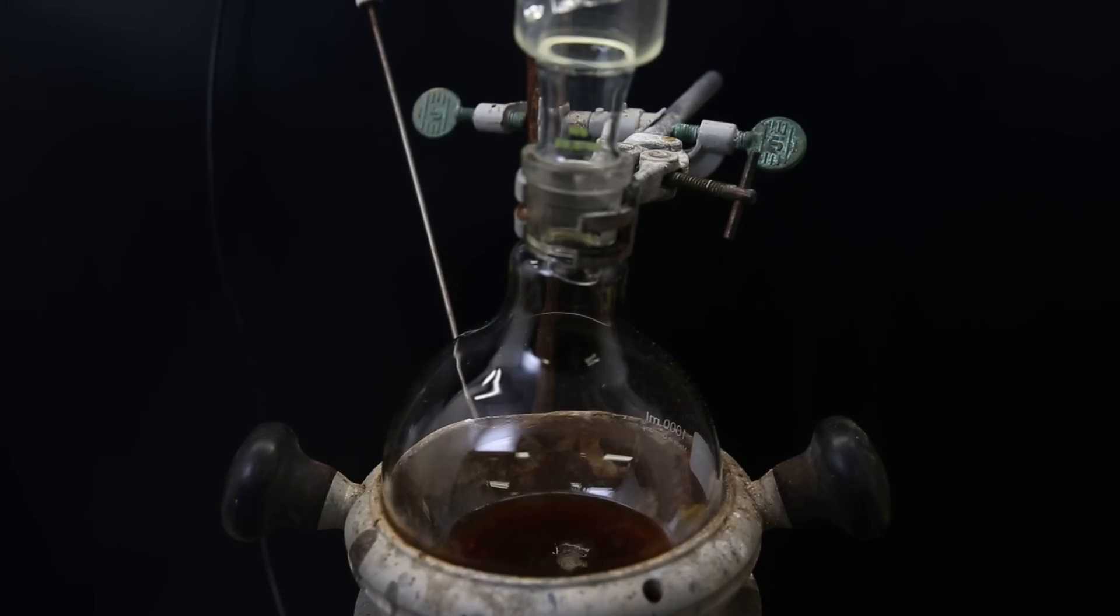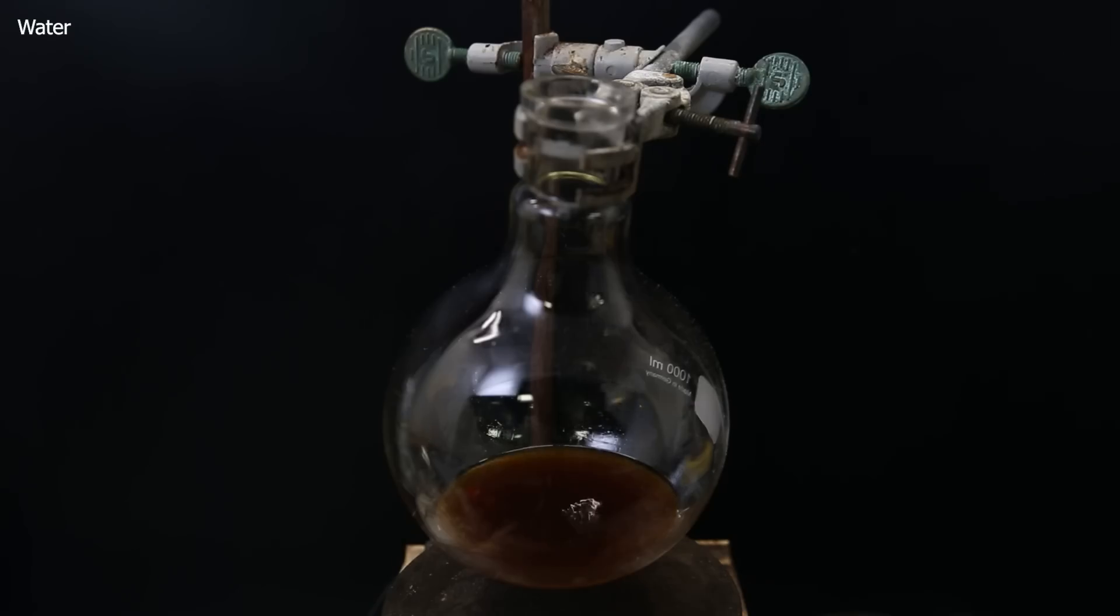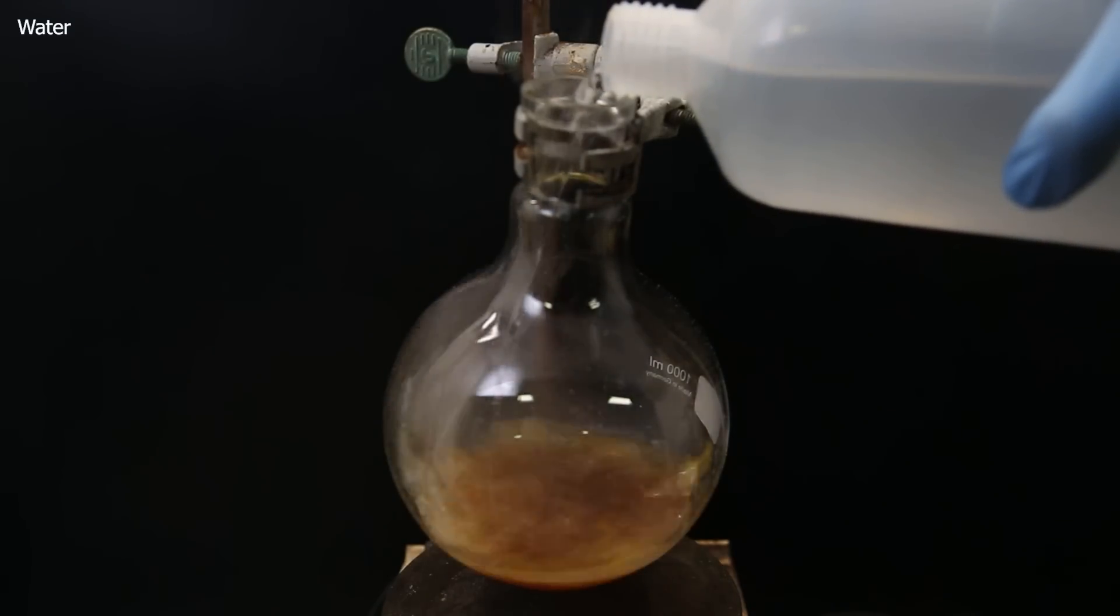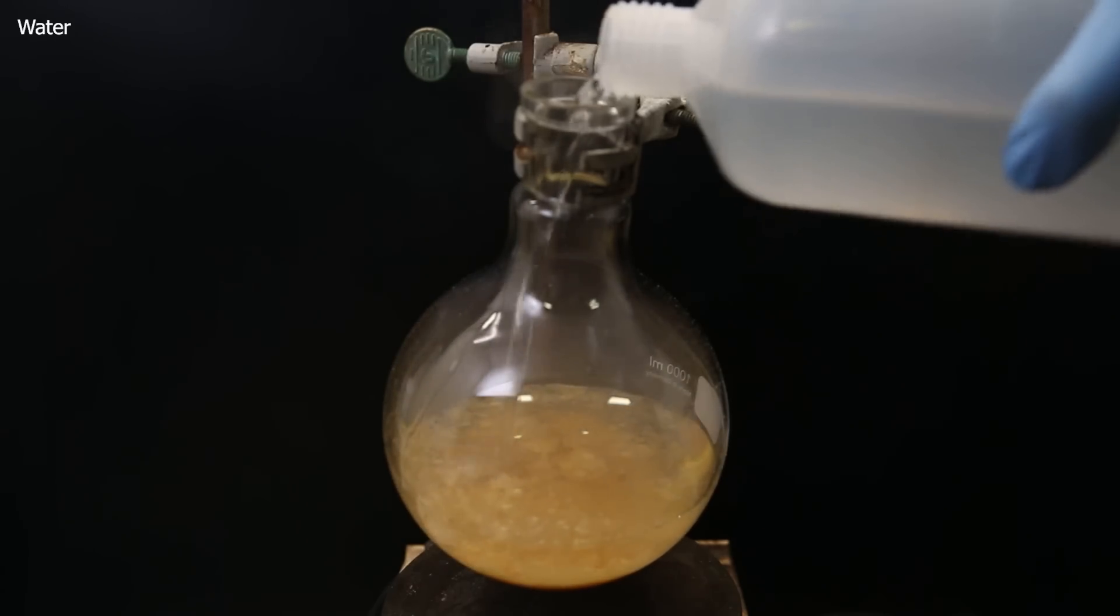When I return, it has become a lot darker, and I take it off heat to allow it to cool down. I then quench the reaction by adding a bunch of water. I expected the water to immediately react with the remaining phosphorus chlorides, but not much happened.